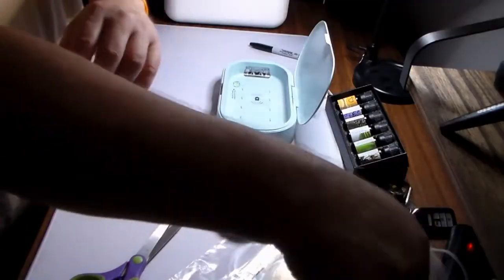We're going to be testing my sock. That's right. In the instructions, it said it will sanitize a sock. Now, I haven't worn a sock in 6 weeks. But I've been wearing this one for almost 48 hours without removing it. So I'm going to take it off. I'm going to swab the inside. We're going to give it a test, see how it does with sanitizing the socks. Can it live up to its claims? We're going to find out. Ready?